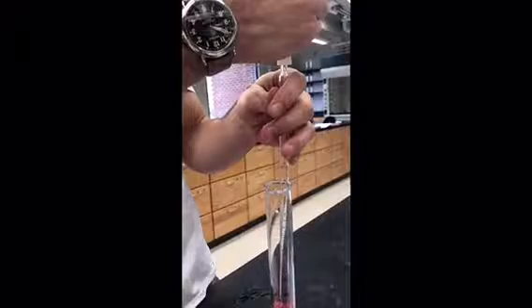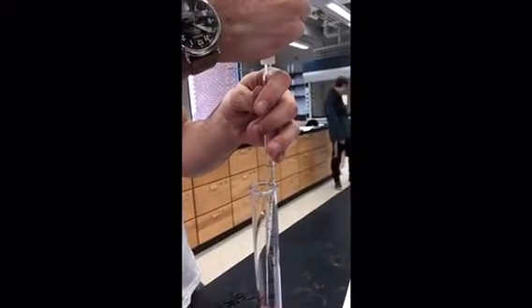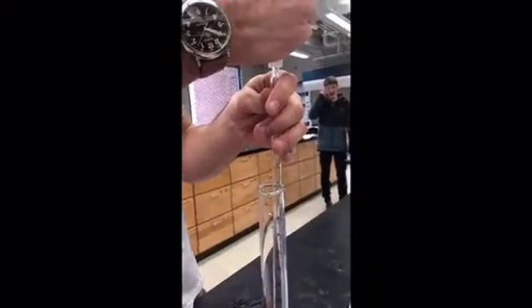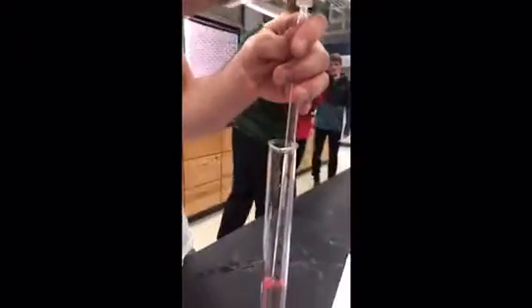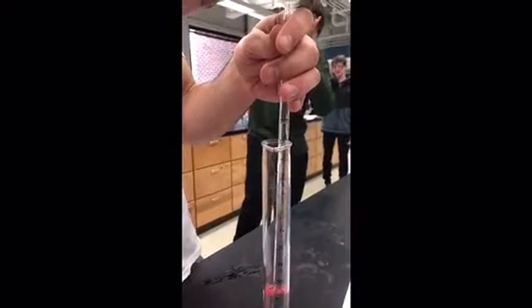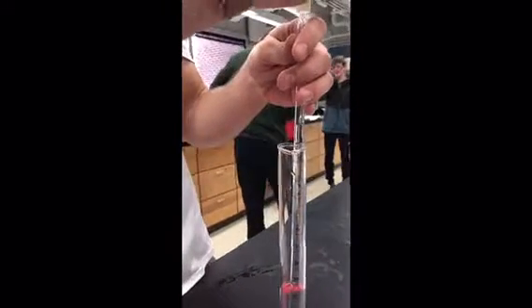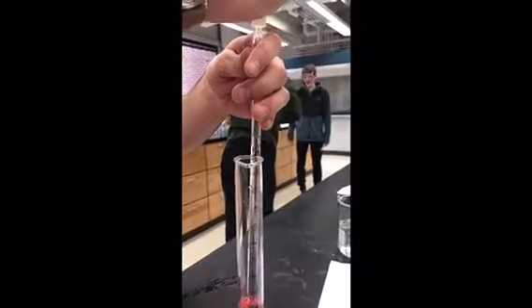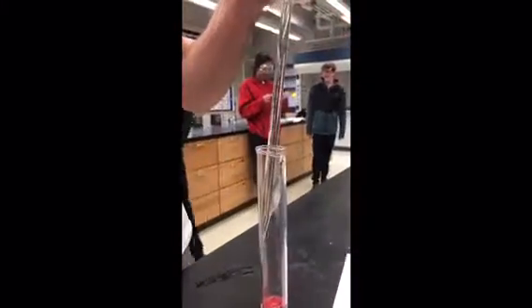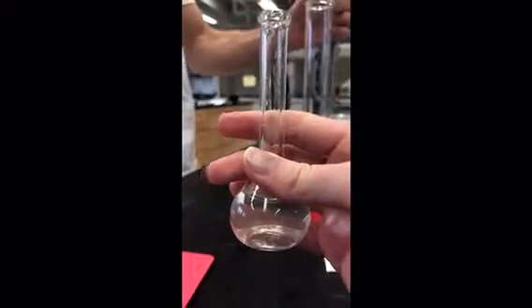When using a pipette to measure a certain amount of solution, you first place the pipette into the cylinder containing solution. Then, you proceed to place a bulb on top of the pipette and squeeze the bulb to release the air inside. Then, slowly release the pressure on the bulb to draw solution into the pipette. Remove the bulb from the top of the pipette and replace it with your thumb to keep the solution from falling out. Then proceed to transfer the solution from the pipette into the flask by releasing your thumb.